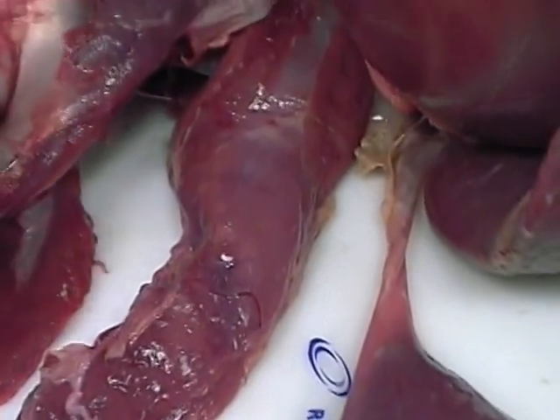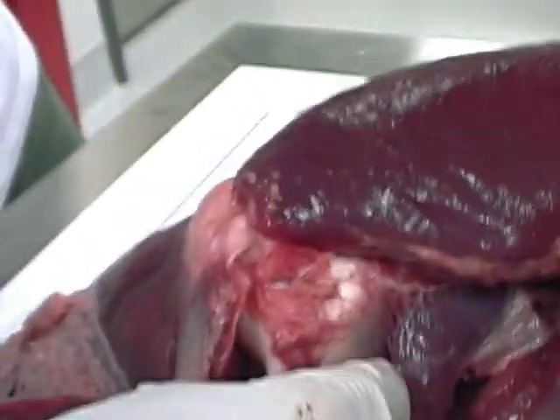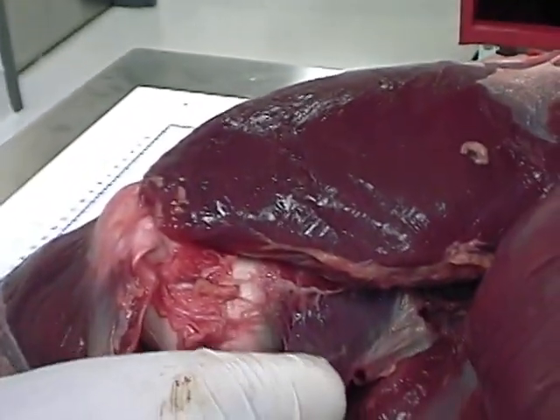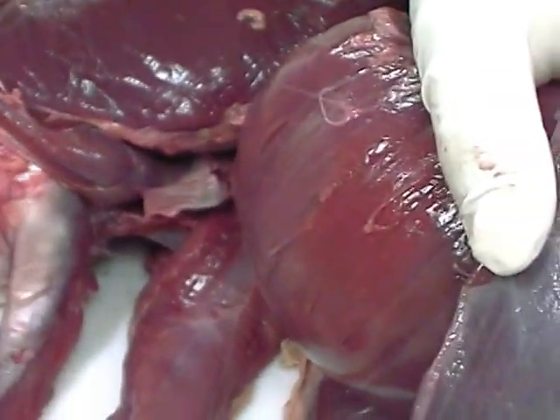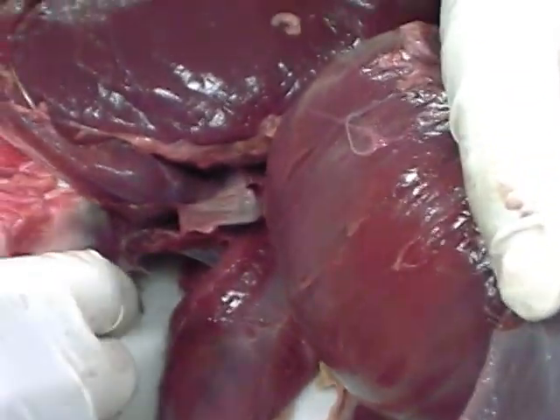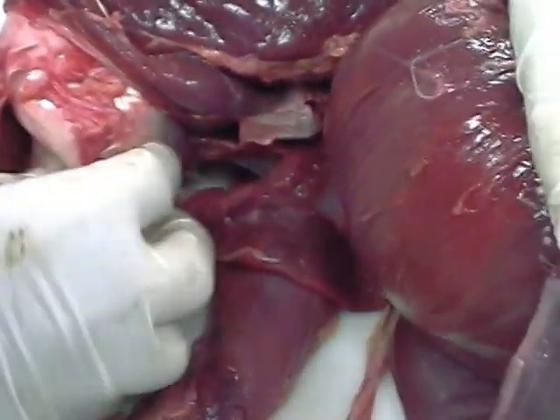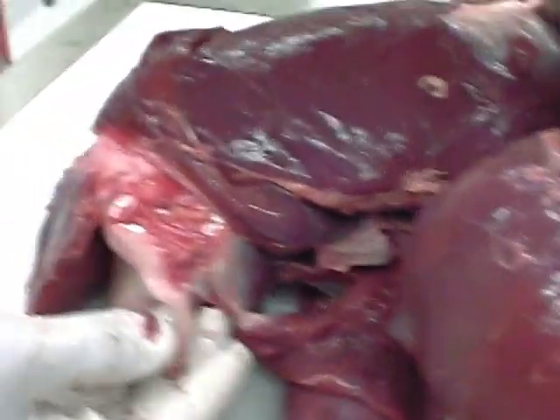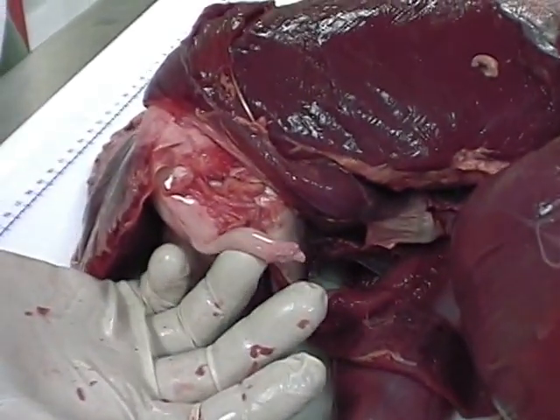And then I can see the tendon of obturatorius medialis, this little guy — could you pull that out? Just the tendon. There you go. That's obturatorius medialis.